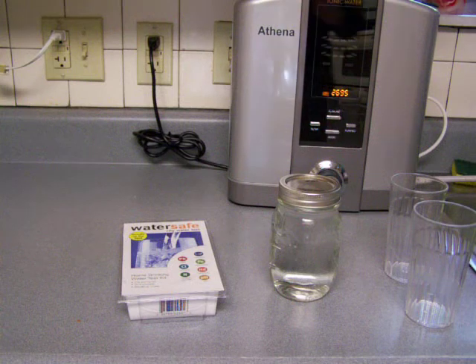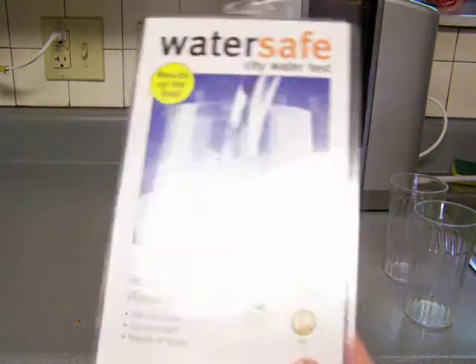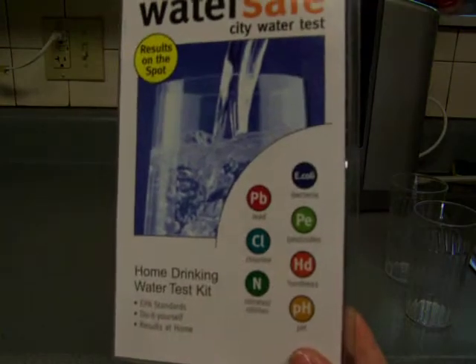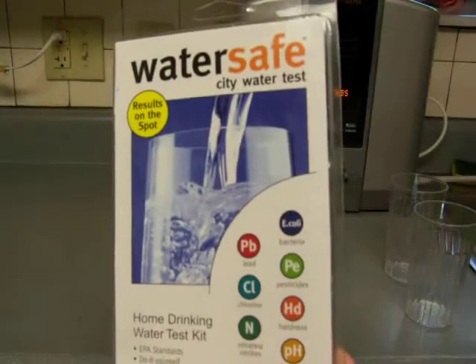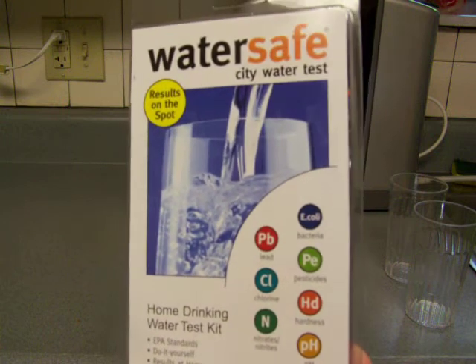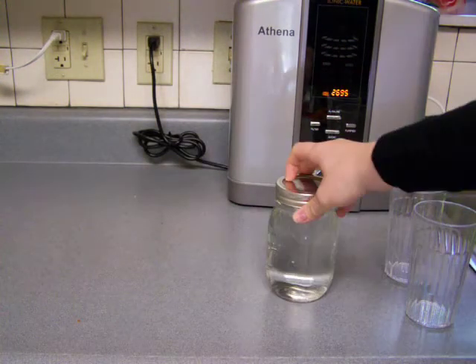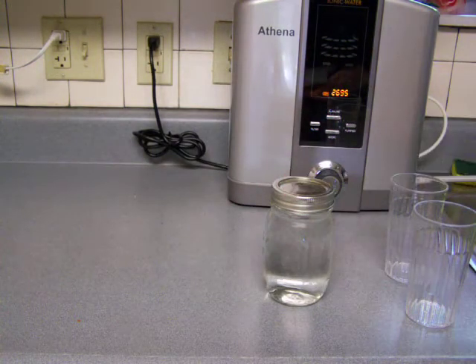Okay, so today we are going to check out, I'm going to do this just to demonstrate to you how you actually do it. I've never, I haven't even opened this yet, so I don't know what it says inside, but it's the city water test. And this is a mason jar full of city water that I got from the city here in St. Louis.